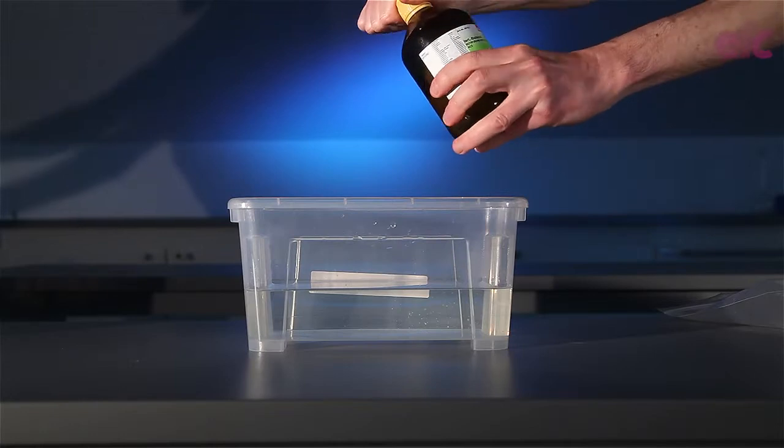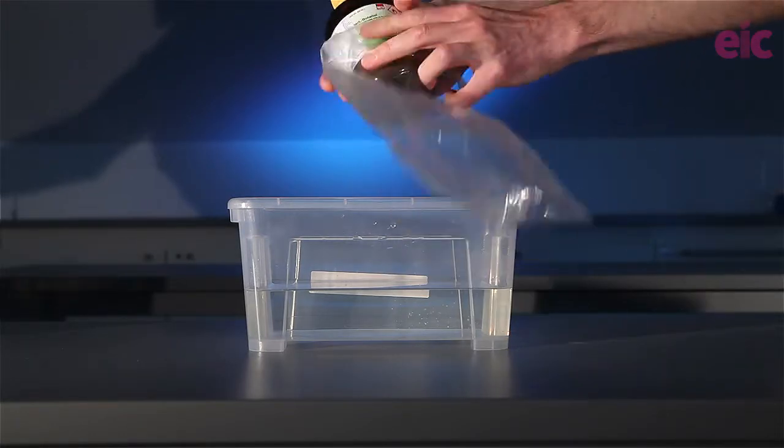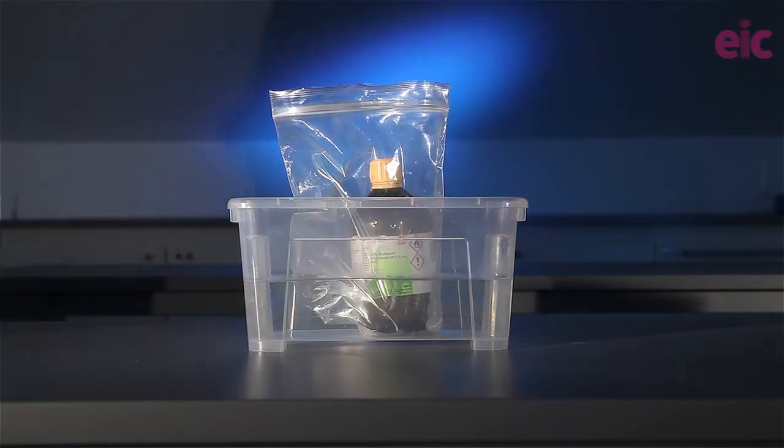In order to get your tert-butanol out of the bottle — it's likely to be frozen when you find it — you'll need to melt it. To do this, loosen the lid slightly, place in a plastic bag to avoid ruining the label, and leave the bottle in some warm water. I advise working with a fresh sample of tert-butanol every time you do this demonstration. You'll find that over multiple demo cycles it will absorb moisture from the atmosphere and melt over an increasingly wide range, which kind of ruins the effect.